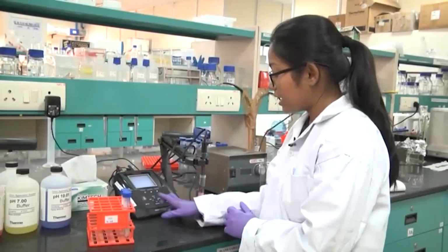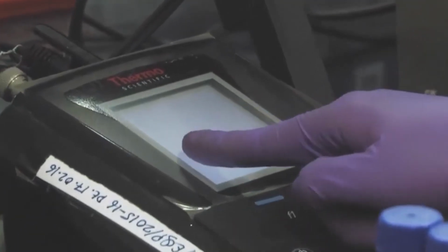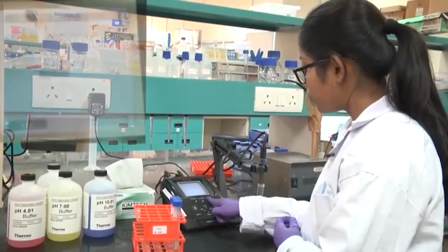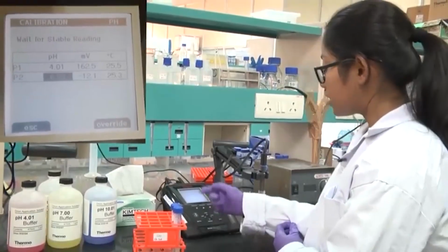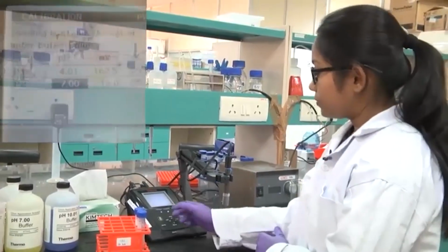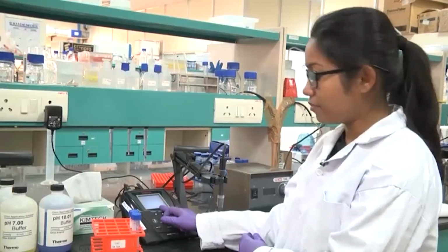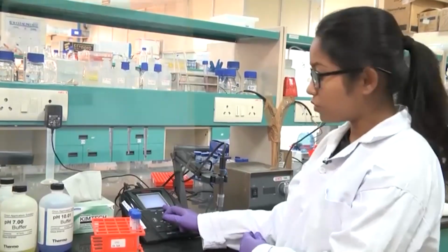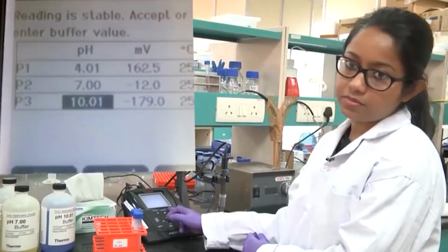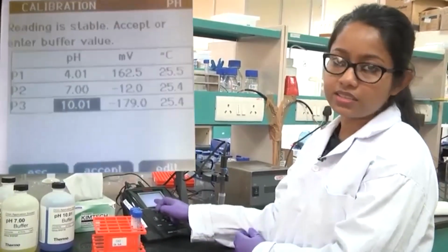Then on this monitor there is a calibration setup, and we will press the calibration setup, and now it will show 1 point. If you then start, it will start getting the pH of that particular solution. You have to wait for some time before the reading becomes stabilized. Do not rush here, otherwise it might be inaccurate. This is blinking right now. Until it stabilizes, wait.